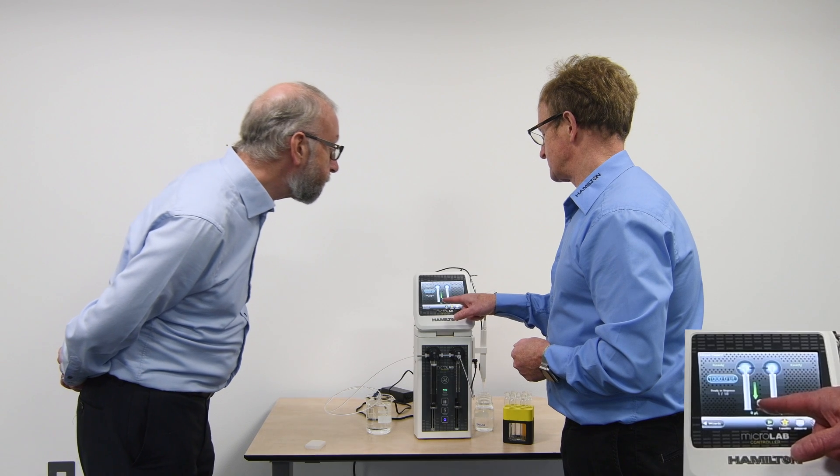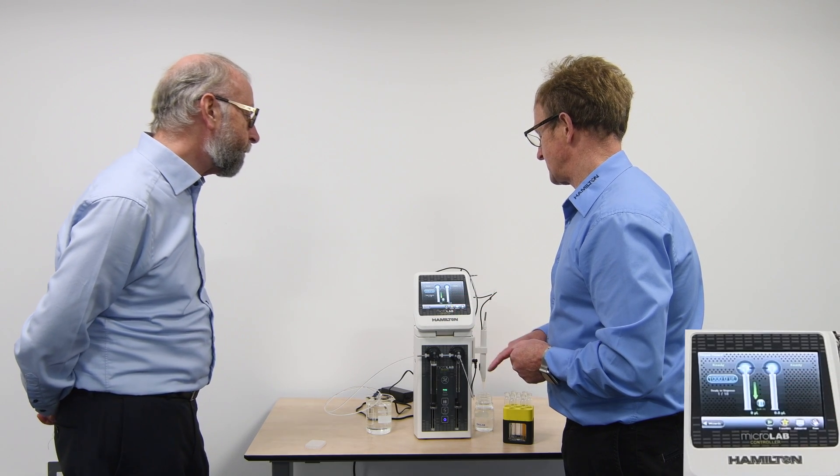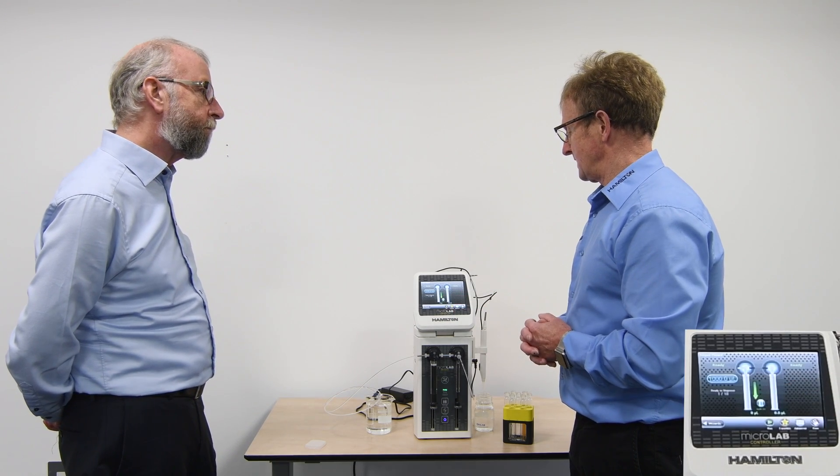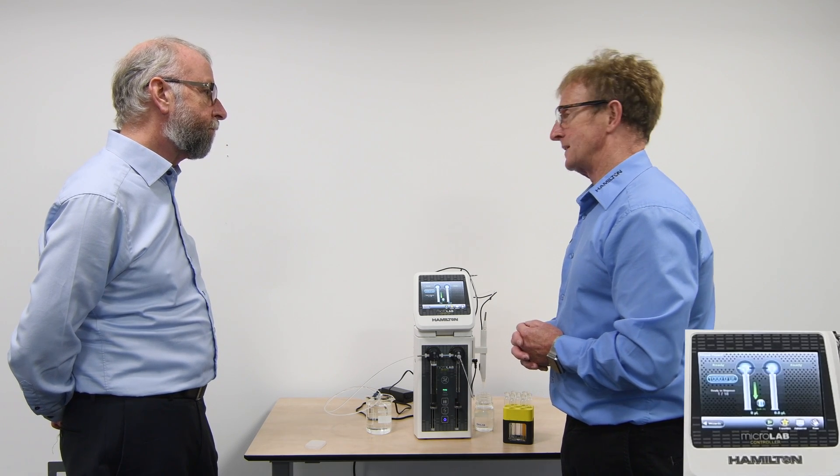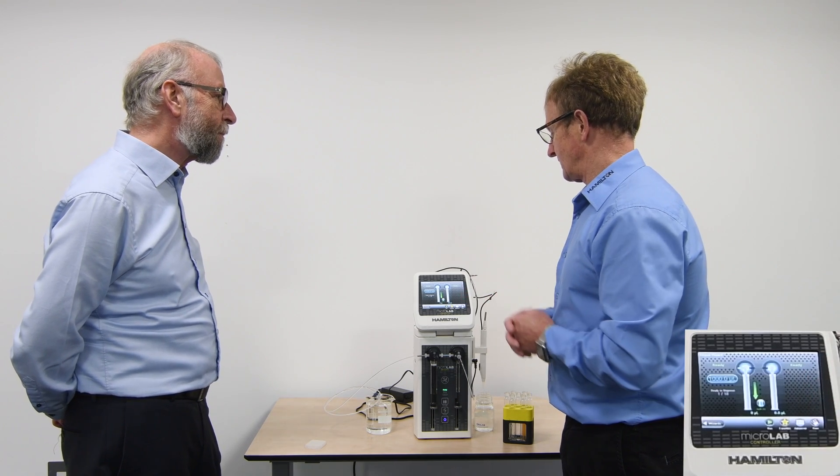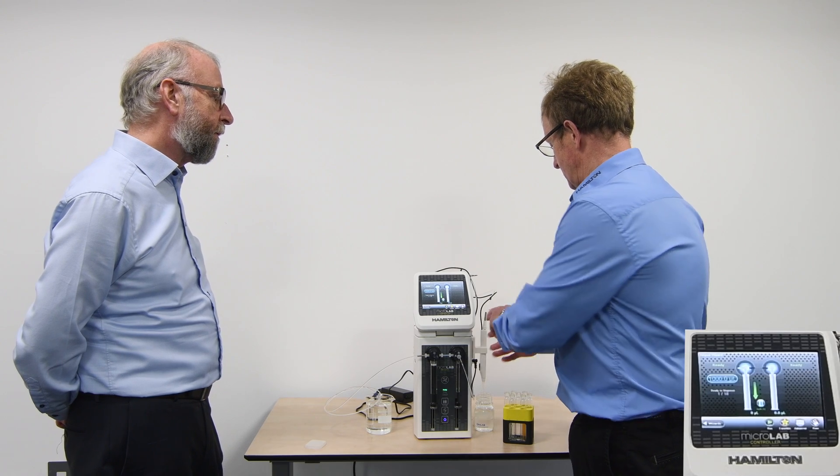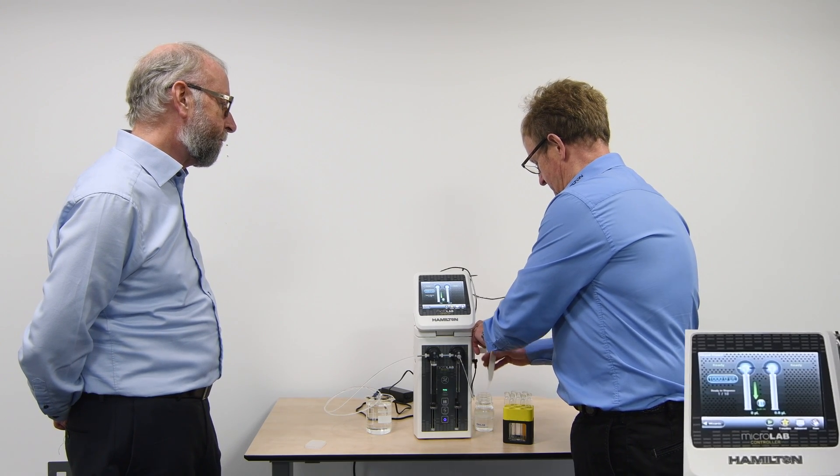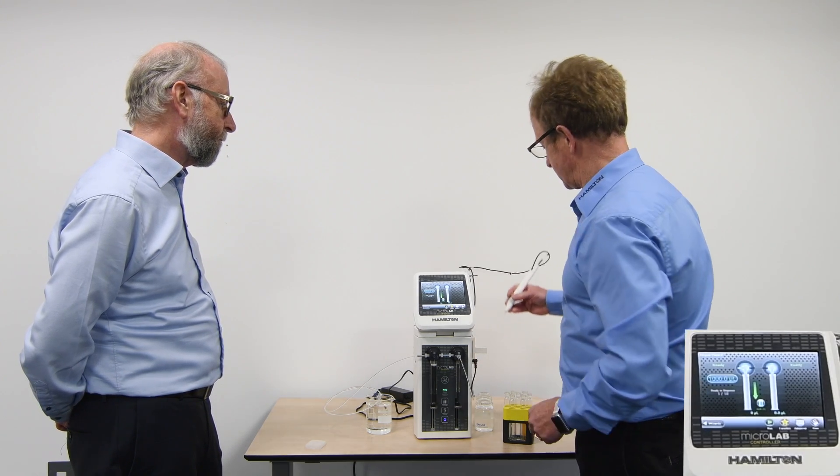So here it says refill off. I'm going to go here, now it's on. So what that means is it will continue to refill and dispense along the lines of what we actually need to do here. So I'll initiate that program and we can see the speed at which that's working.